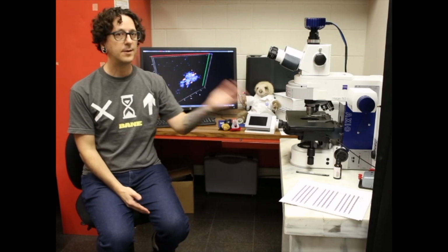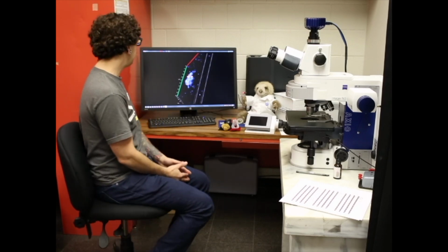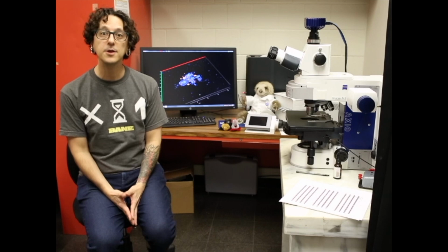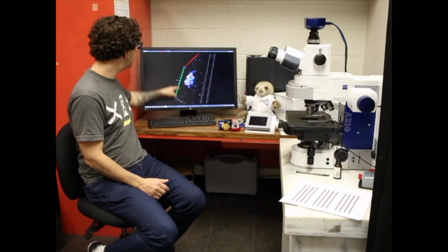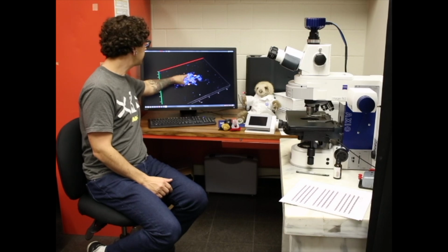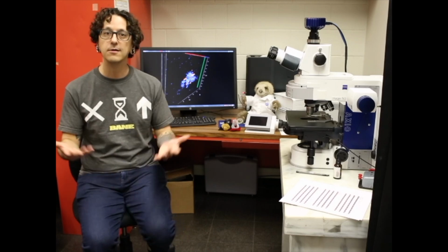So this is my microscope, and behind me you see one of my favorite videos of a bunch of bacteria eating oil. In that particular video, all the little blue dots are single bacteria cells, and these gold dots here are little droplets of oil. One of the things I study is how bacteria eat oil after oil spills, and clean that up naturally.